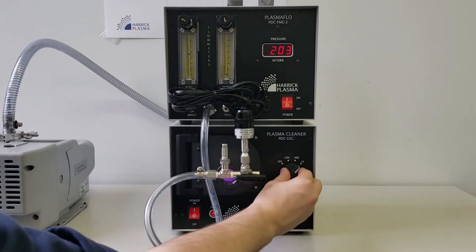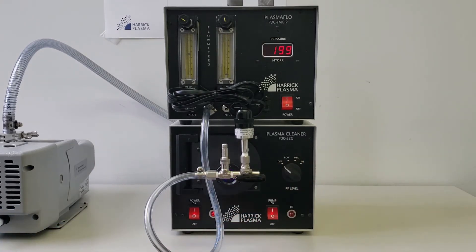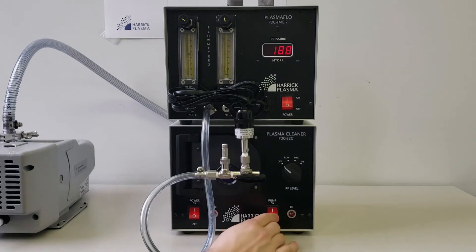After about 50 seconds, turn the RF power off. Turn off the vacuum pump and the main power.